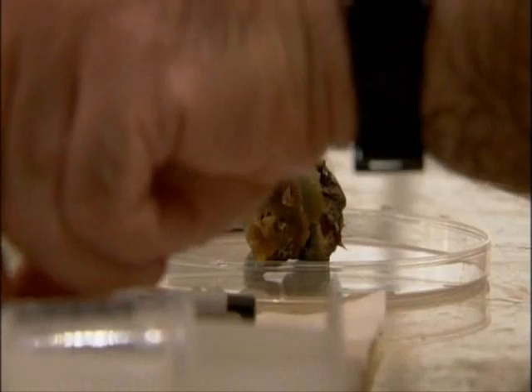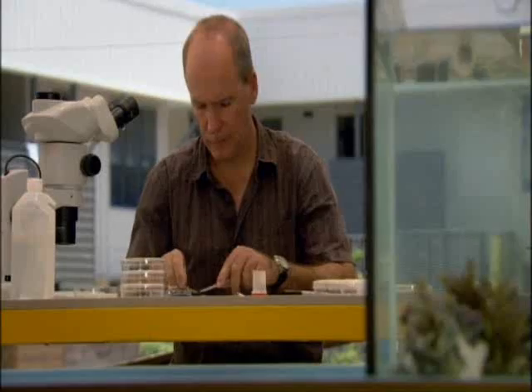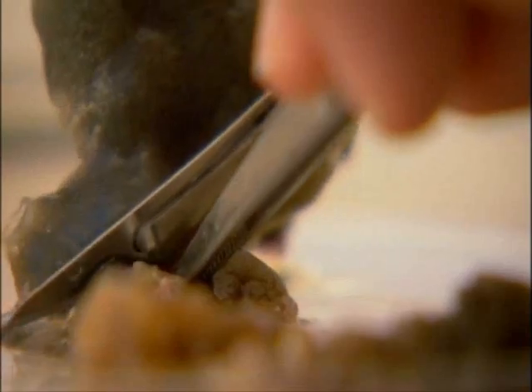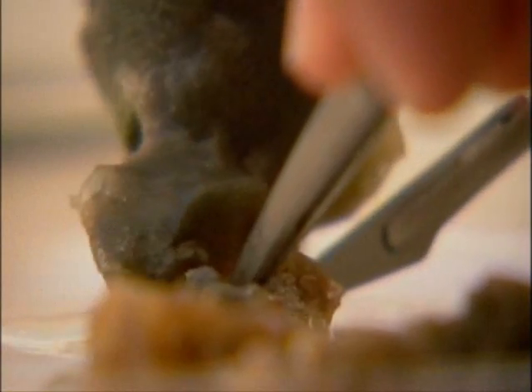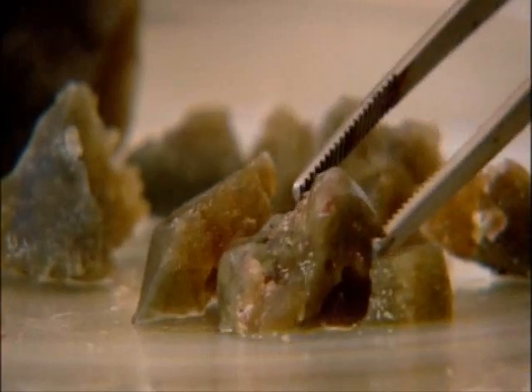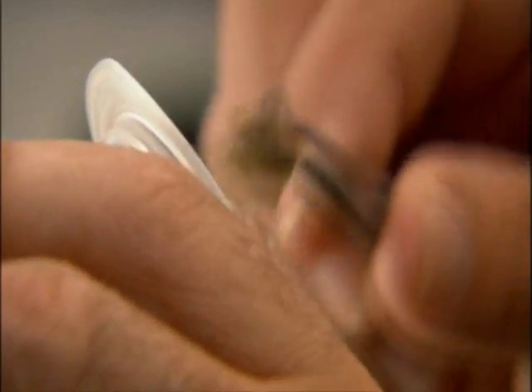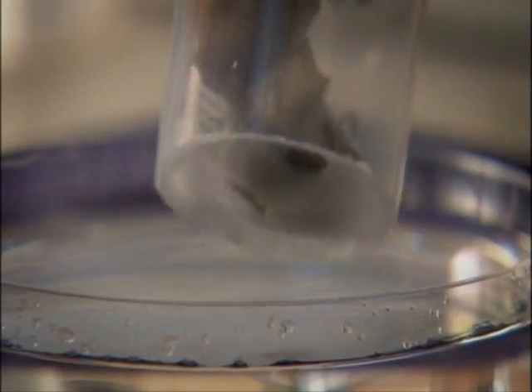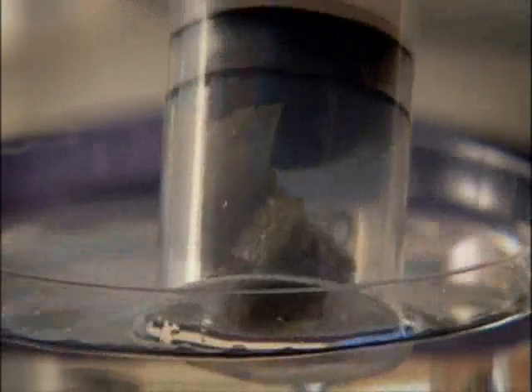A classic experiment gives us some insight. First, a sponge is cut into small pieces. Then it's pushed through a sieve at the end of a syringe. This breaks the animal down into its individual cells.